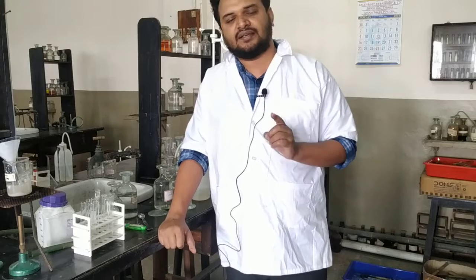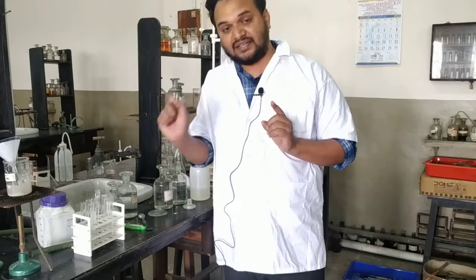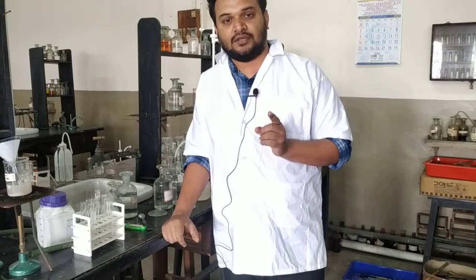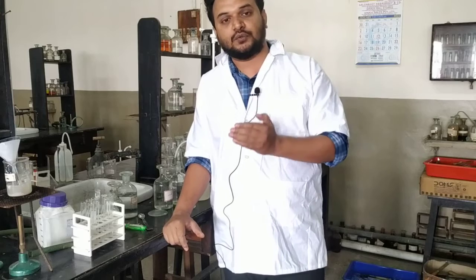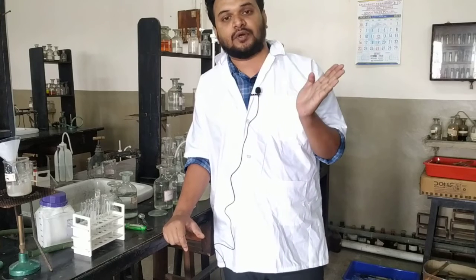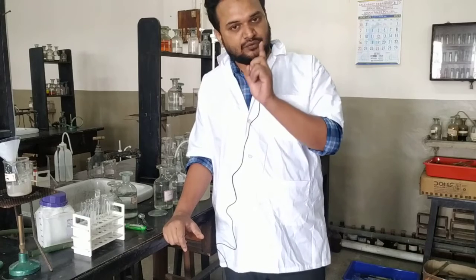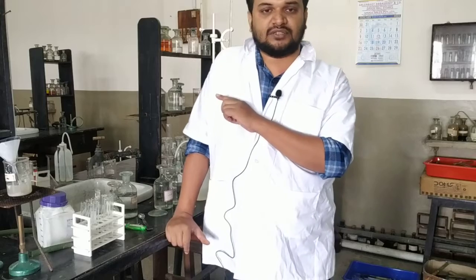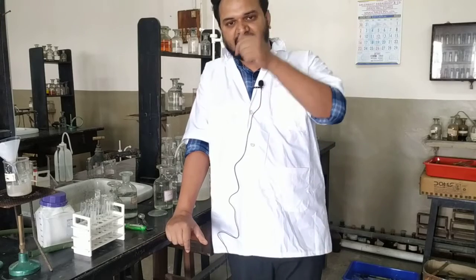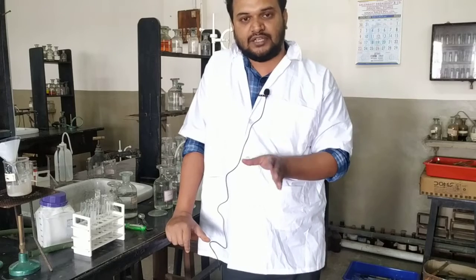Remember one thing, your performance will not carry the marks. What you are writing, that will carry the marks. So don't forget to write for the cation that groups 0, 1, 2, 3 are absent with their corresponding experiments, and then only you can write group 4 present, then you will be given the full marks. And then for the confirmatory test with potassium ferrocyanide, or adding NaOH, initially a precipitate comes, then it gets dissolved. Now Zn2+ is confirmed.